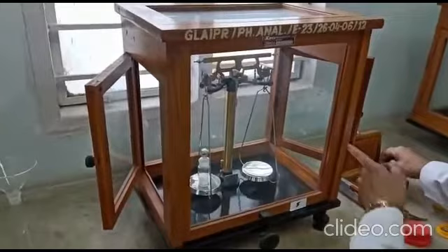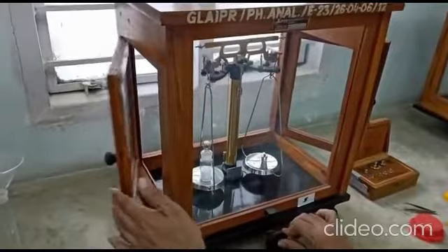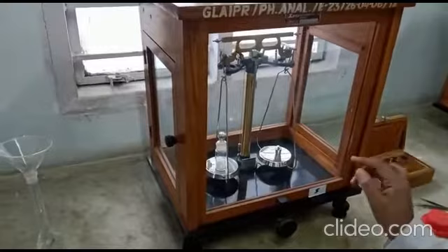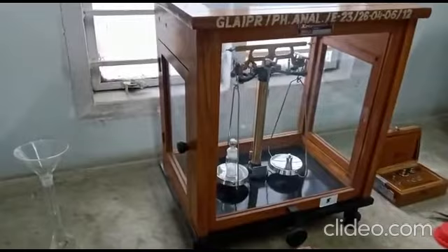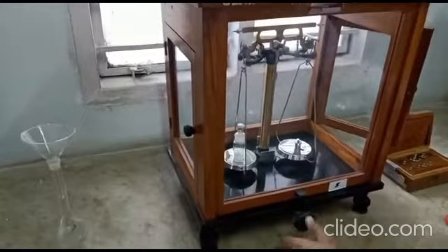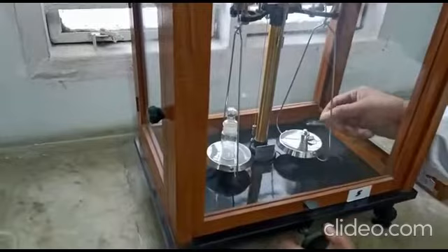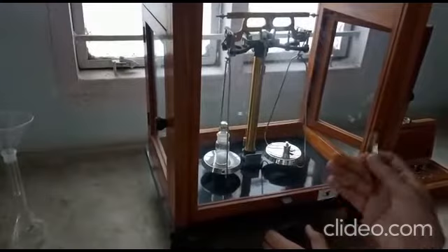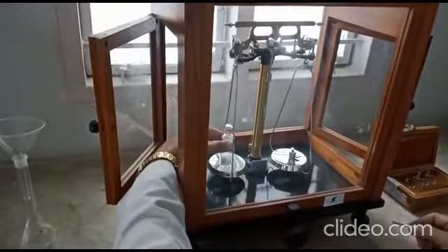We place the weighing bottle on the left-hand pan of the analytical balance and add weights on the right-hand side. We un-arrest the balance and observe where the pointer goes — if it goes against, the reagent bottle is still heavier. We keep adding weights cautiously until the balance is achieved. After obtaining 630 mg on the balance, we transfer the oxalic acid powder by tapping into the volumetric flask.